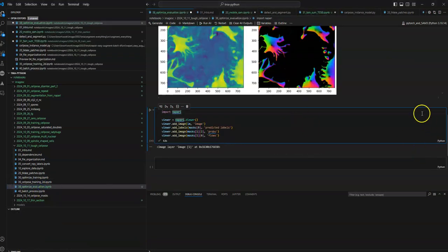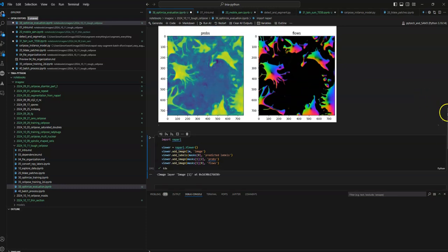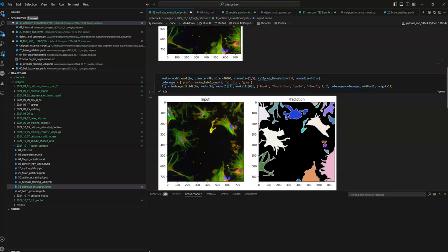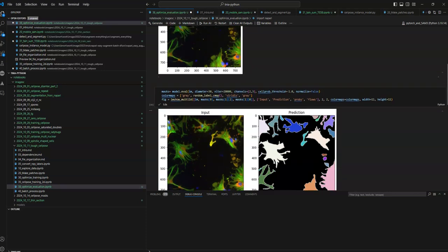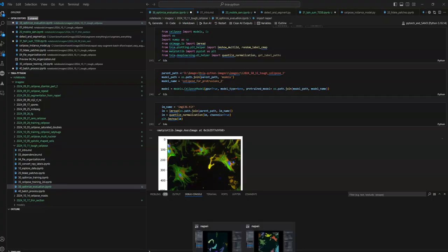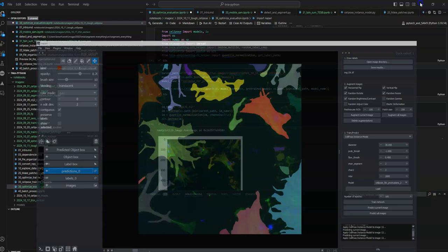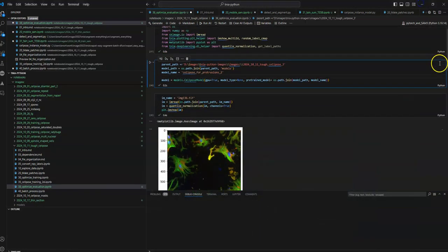Okay, and then Notebook 38 is similar to Notebook 30 in a way. That was optimized training, this is optimized evaluation. So I load in images and test the predictor on it while also trying to optimize some of the settings. If you look at this image here, this is the one I was looking at in Napari at the beginning of this video, where we're missing this section here. I was just playing with it a little more to see if I could try to fix that.